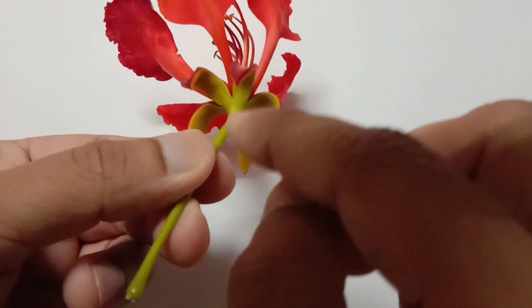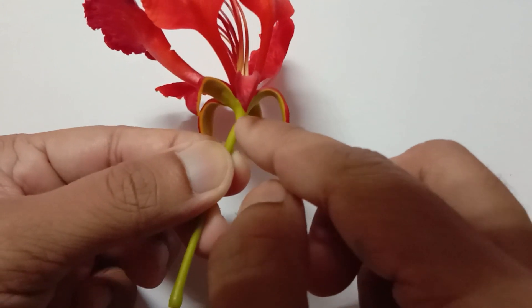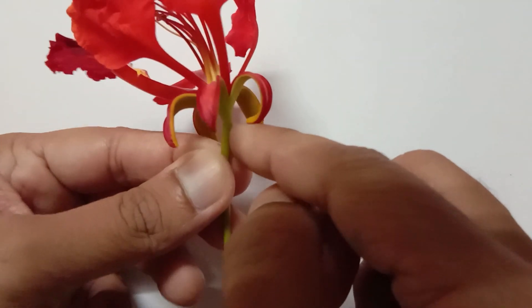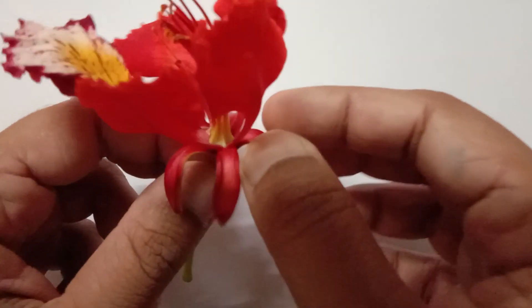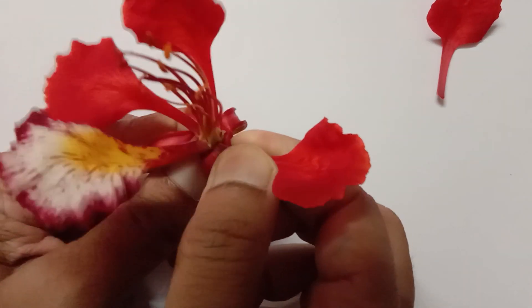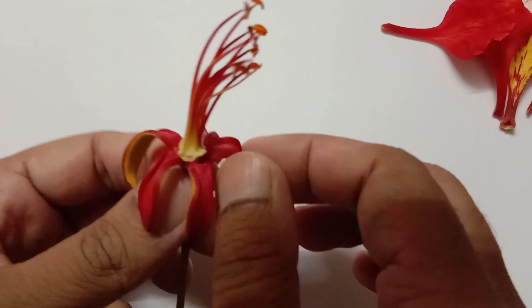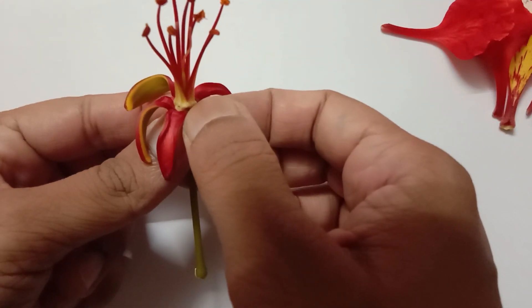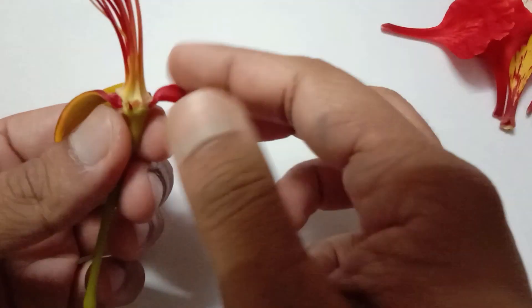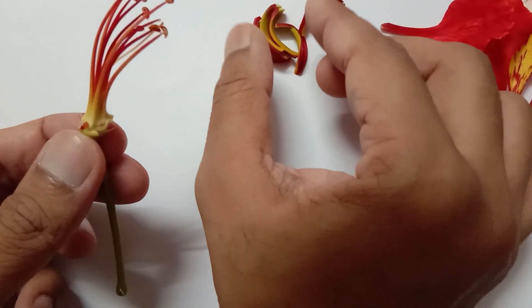There are a total of five sepals, and all five sepals combined are referred to as calyx. This bottom base part of the female reproductive part is referred to as thalamus, above which the ovary resides. This long stick-like structure is referred to as pedicel, over which the whole flower rests. Now let me remove all the petals one by one, and then all the sepals — these are combinedly referred to as calyx.